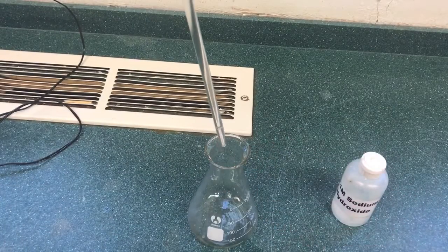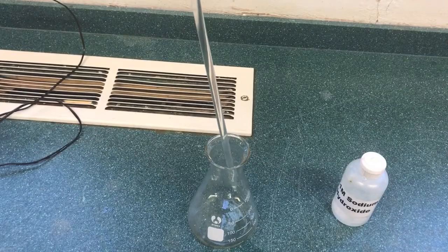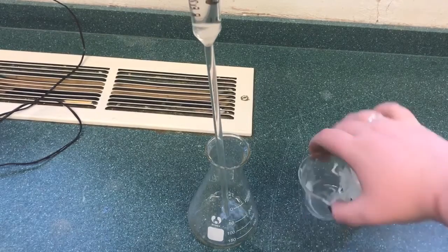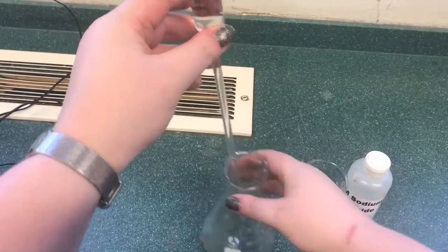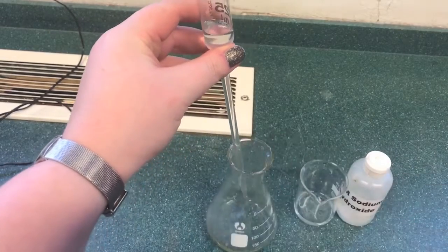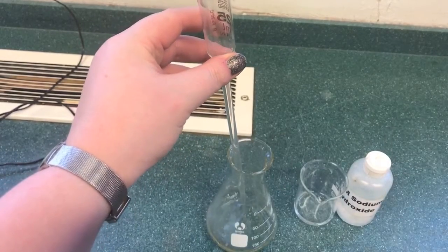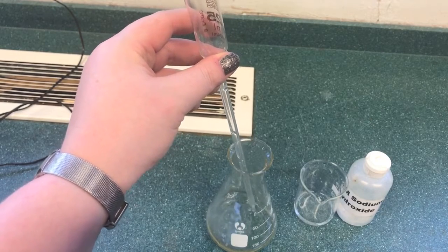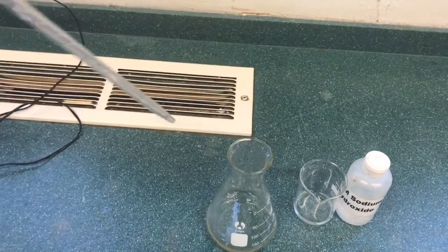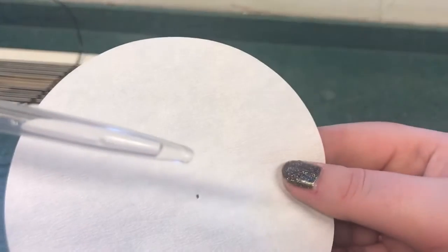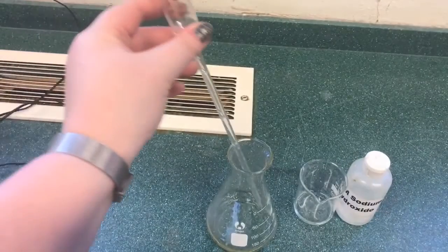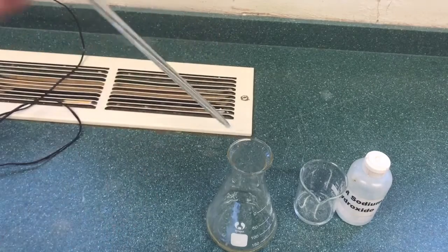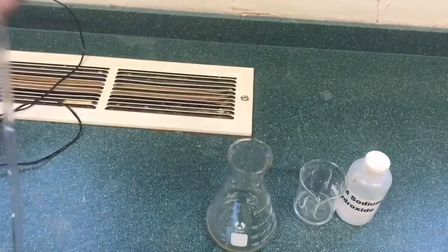This solution is then transferred to a conical flask. The solution is allowed to drain into the conical flask. Once all of the solution has drained, it will appear that there is a drop left within the pipette. The pipette is then touched to the edge of the glass and one drop should be left within the end of the pipette.